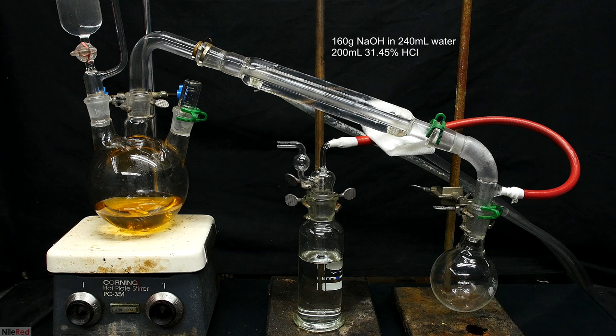This is what the second one looks like, and at first glance, it might look a little bit complicated. There's two things directly attached to the reaction flask. On the left is an addition funnel with sodium hydroxide solution in it, and in the middle we have a condenser. Further down from the condenser, I've attached a receiving flask, which mostly acts as a trap. Between the receiving flask and the condenser, I have the vacuum takeoff adapter with a hose attached to it.